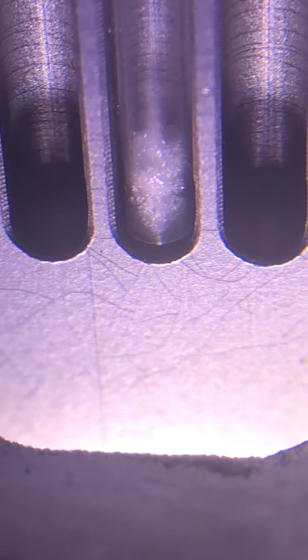On the left hand side you can start seeing beads of liquid. I'm not sure you would see that without being magnified like this. And now it's starting everywhere. So 121.1.